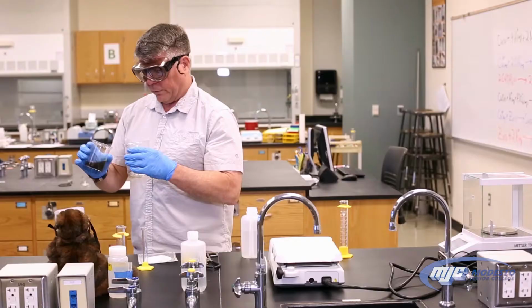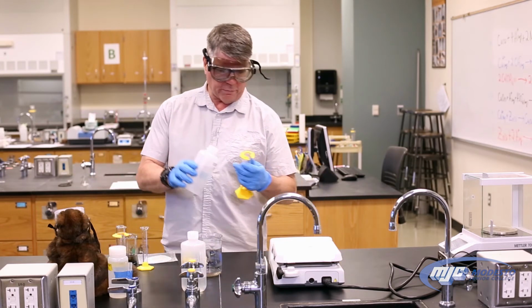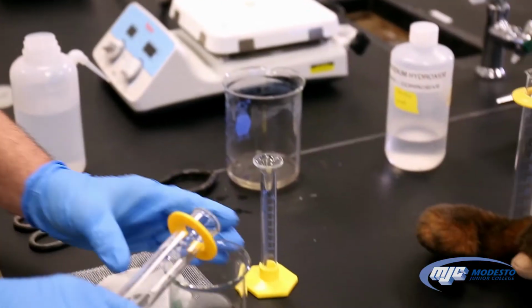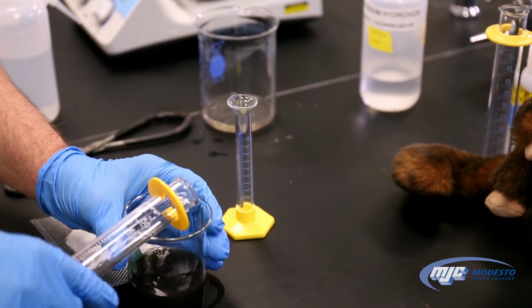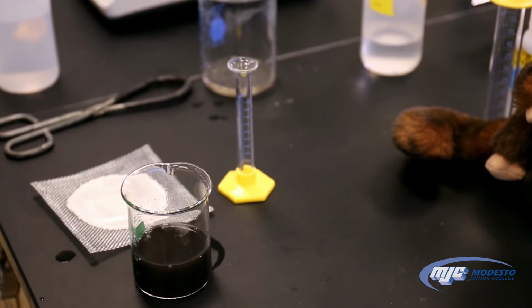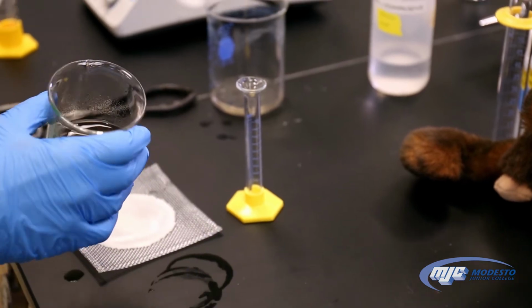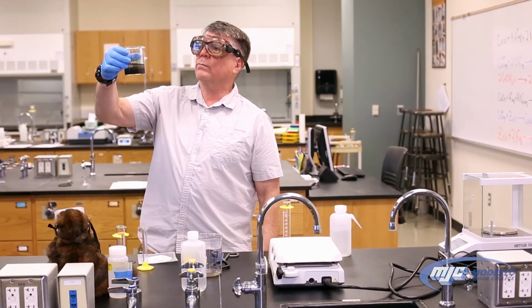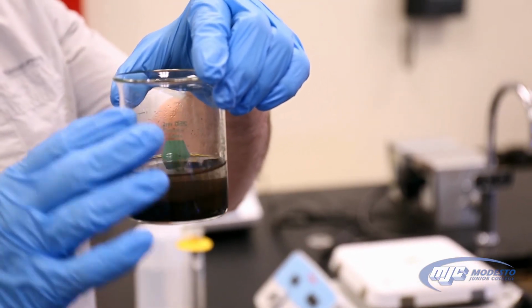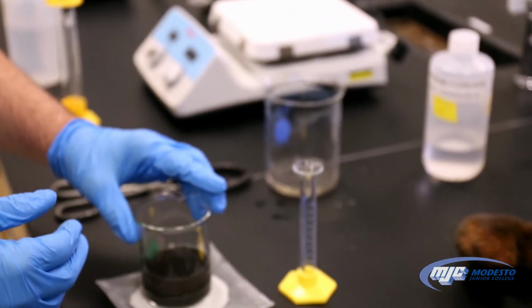I'm going to stop there because I saw some copper 2 oxide starting to get transferred over. I'm going to do that one more time. Add about 25 more mils of DI water. Good enough. Yeah, give it a little swirl. Let it settle down. So if you can see that there's still some cloudiness up here, I want to wait until it settles down a little bit and is more clear. So we're going to set this down and we're going to wait for a few minutes.